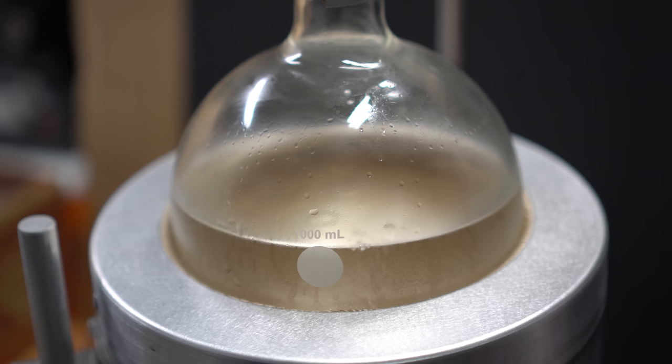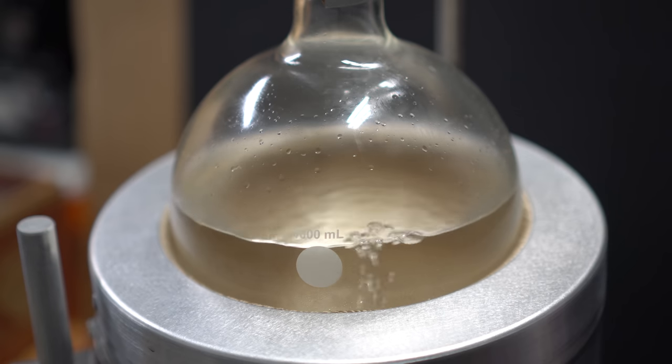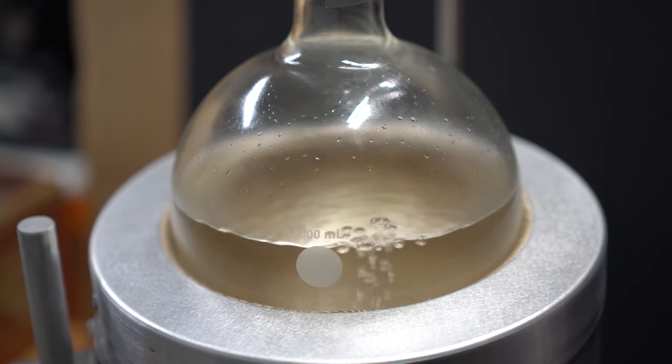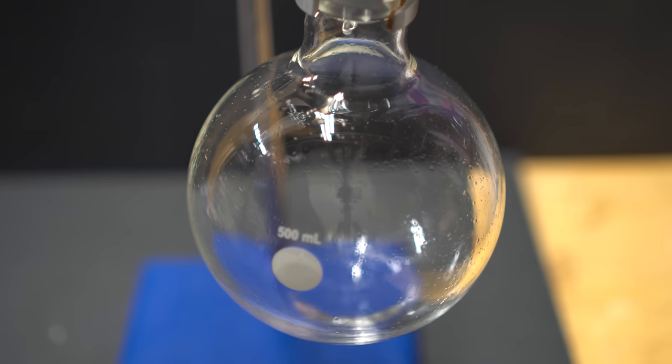When you initially start to heat up your mixture you'll see some bubbling come out of it and that's just off gassing from the dissolved gases into the solution. This will bring some diethyl ether over so don't be afraid if anything starts to come over right away.